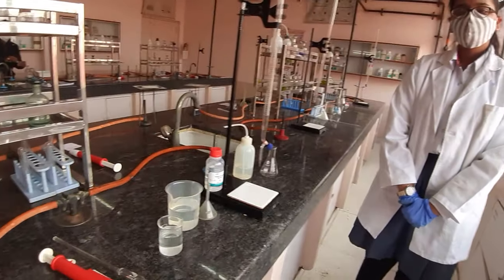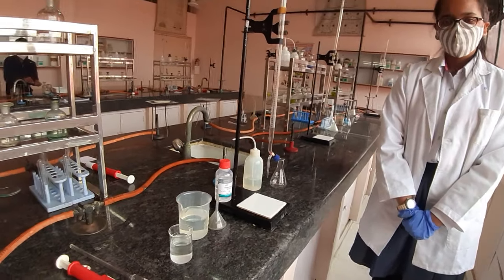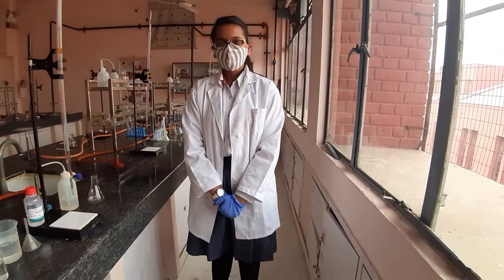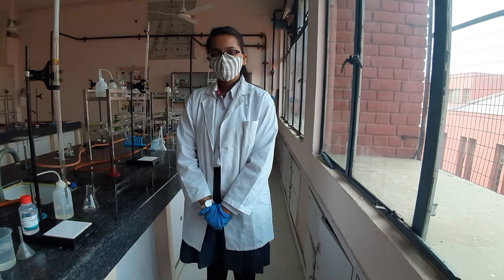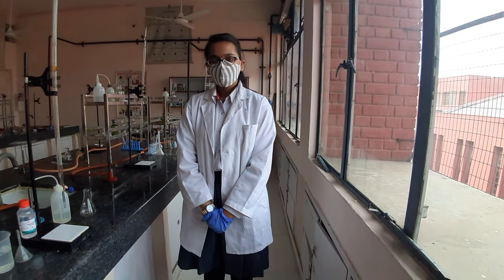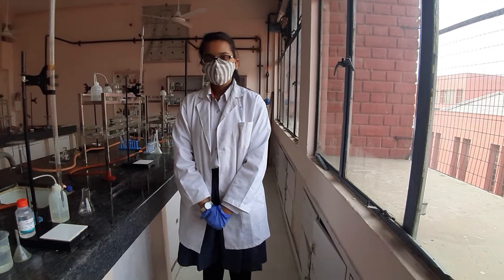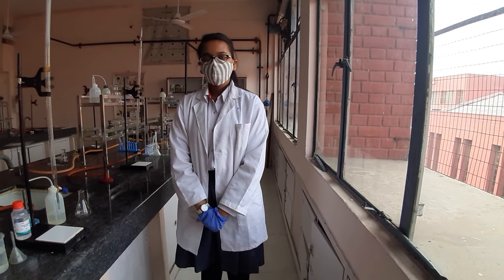Good morning class 11th. Today's agenda is to do a titration, and my student Suhani would be performing the titration for class 11th. This is an acid-base titration of NaOH versus oxalic acid.